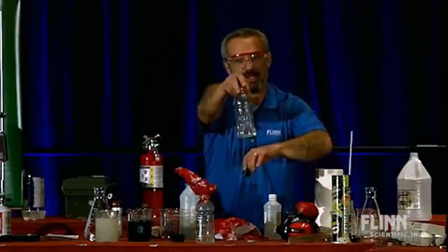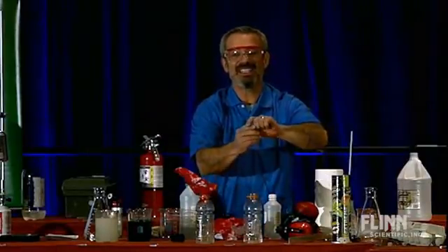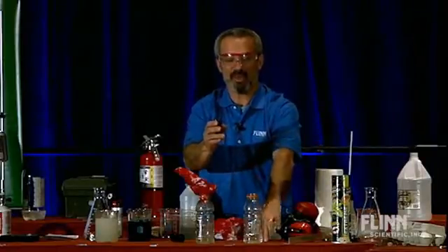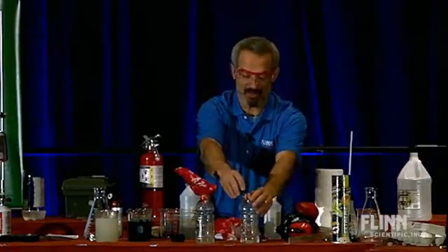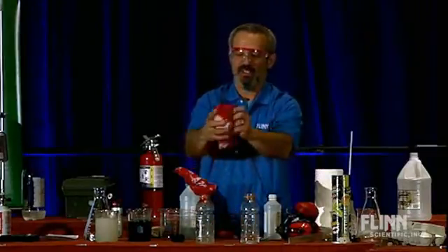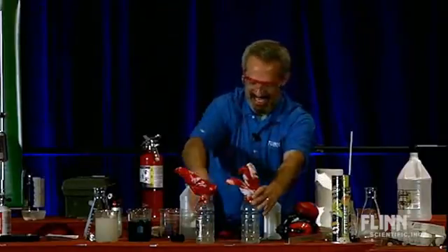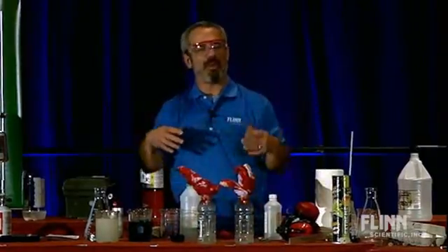In my other identical bottle with an identical hole and an identical amount of water, I'm going to put five times as much — 1.5 grams. Still not very much. And shove a nearly identical bandana in there. That gives it a little bit of time to react.